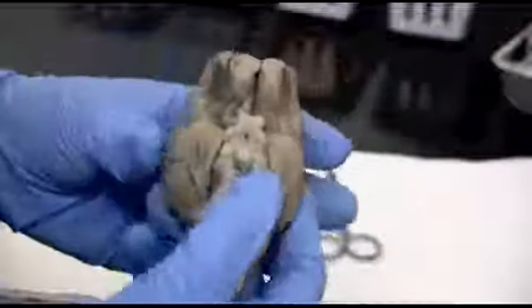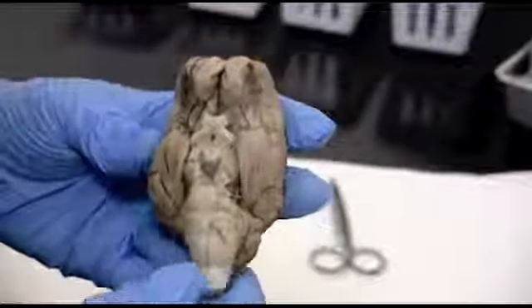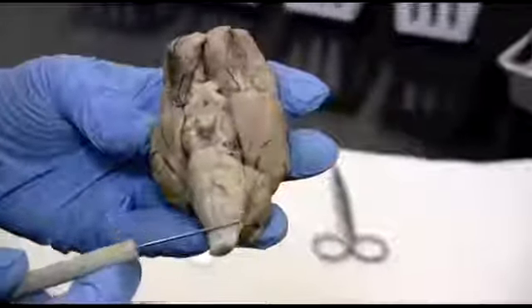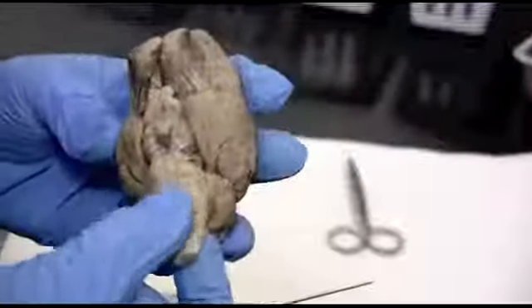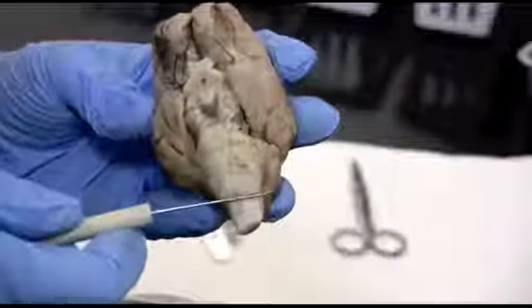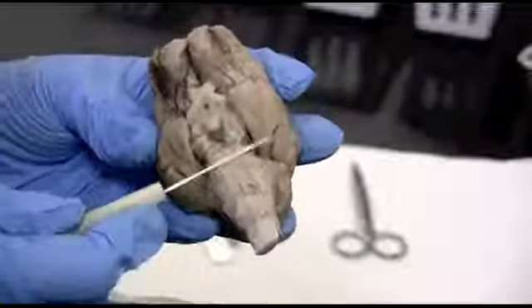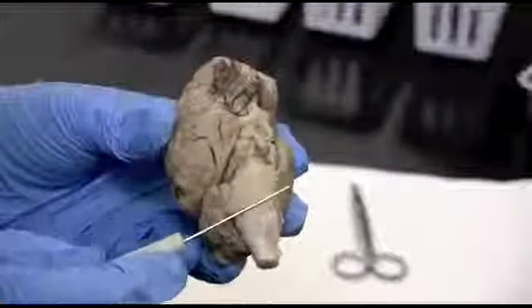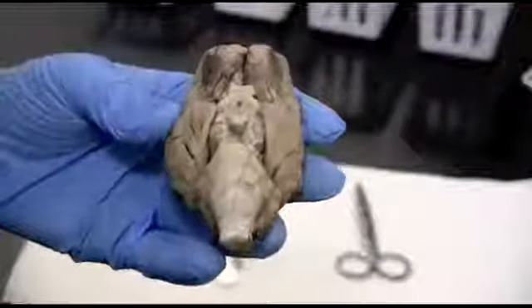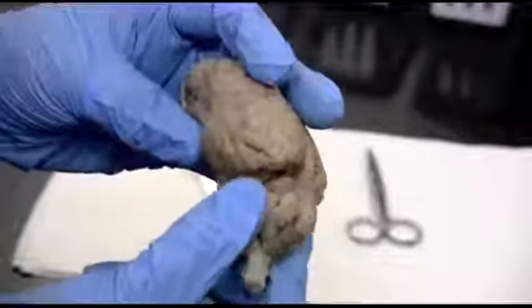Now we're going to look at the inferior side. This is the underside of the brain. And you can see the brain stem pretty well down here. It starts off with the spinal cord. And then when we get up to this first bump area right here, that's going to be the medulla oblongata. So we transition from the spinal cord to the medulla in this first poofing out. The second set of bumps right here is going to be the pons. Those are the two ventral parts of the brainstem, and then we've got the cerebellum right behind it.